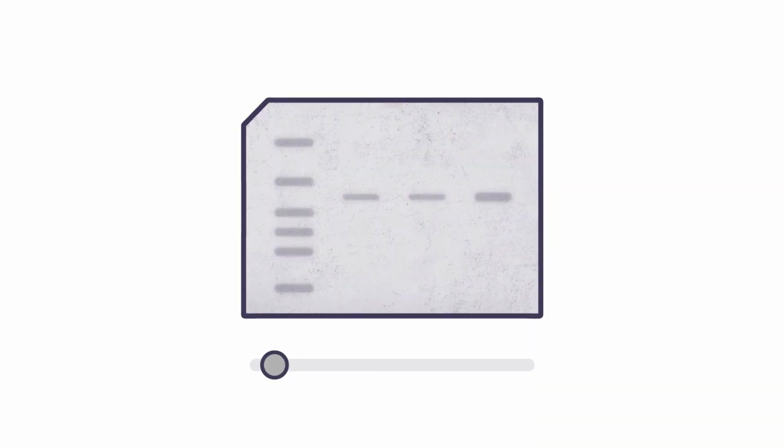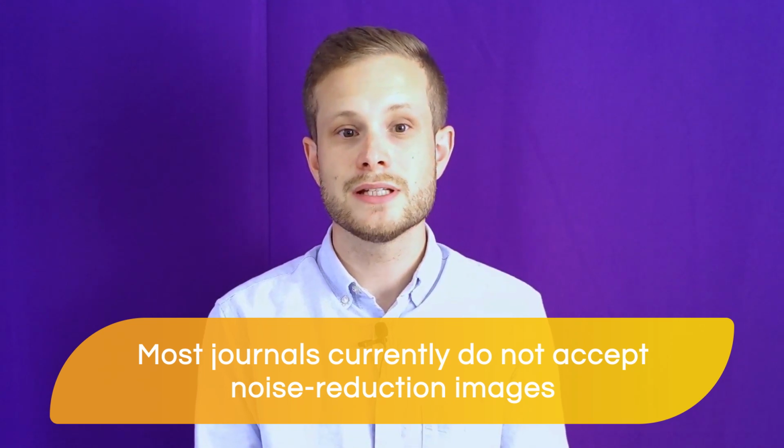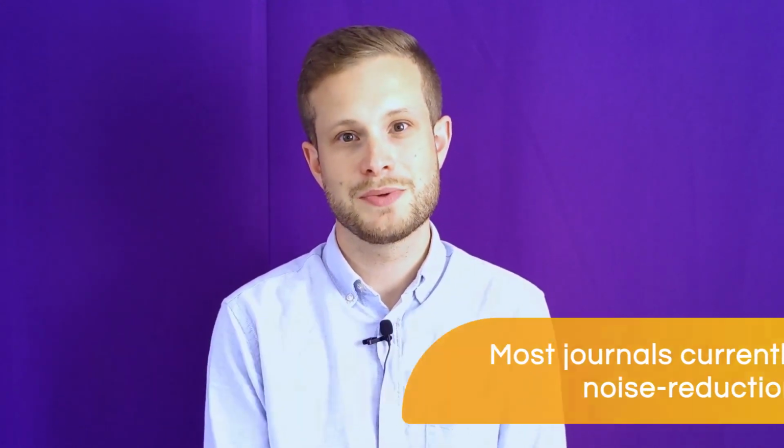Another modification that could be applied by the software is the use of a noise reduction tool. This is a special software tool that can be used to improve the appearance of an image by cleaning up speckles of dust or dirt, or perhaps electronic noise that's been introduced by the camera chip or the detector. There are many different methods and algorithms that might be used for noise reduction, but all of them will modify the data that will be quantified from the image, and they will change the way that the image will be visually interpreted. The software has no way of telling which pixels are noise and which pixels are genuine signal, and so some signals will be lost or changed by the use of the noise reduction tool. For this reason, it's never recommended to apply noise reduction to your images. Most journals currently don't accept noise-reduced images, even for presentation purposes only.